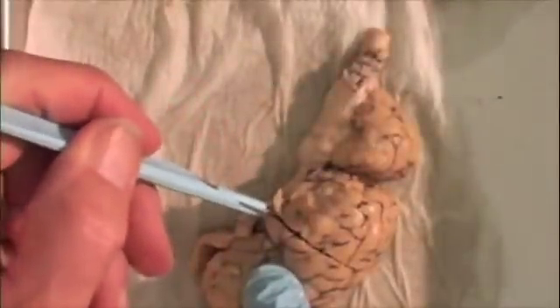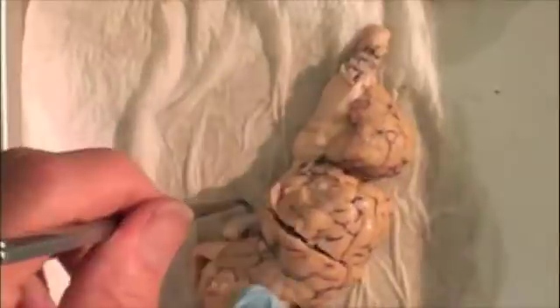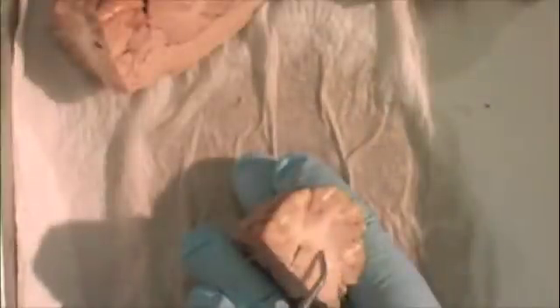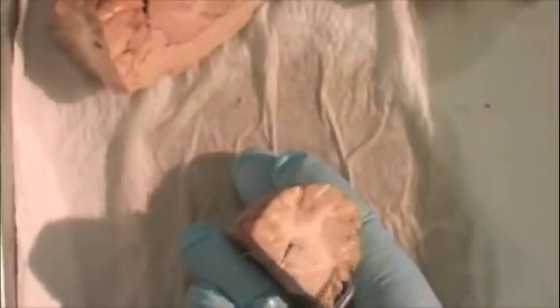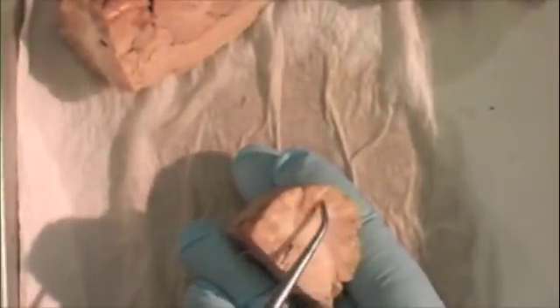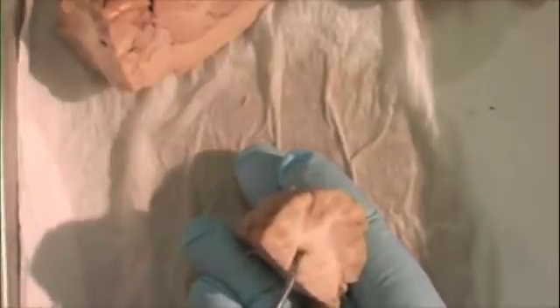If we make an incision into the cerebrum and remove the section, we get a rather nice view of the internal white matter and the surrounding gray matter, the cerebral cortex.